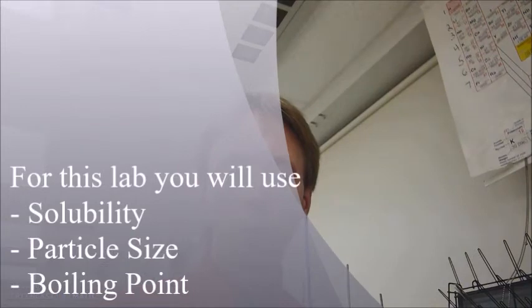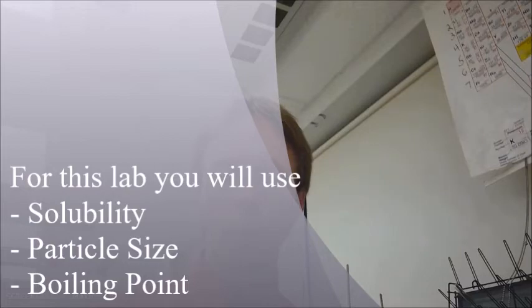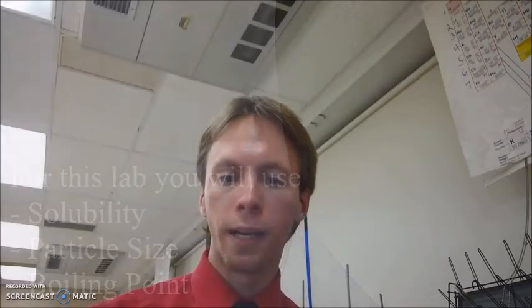For example, you could use density, which we did in our density of plastics lab. You could use solubility, or you could use temperature of a phase change, such as a melting and a boiling point. For today's lab, what we're going to do is we're going to look at differences in solubility and differences in particle size and differences in boiling point to separate components of our mixture. So let's begin the lab.